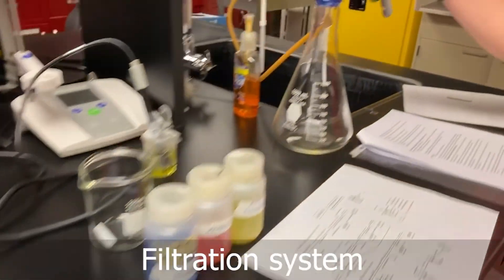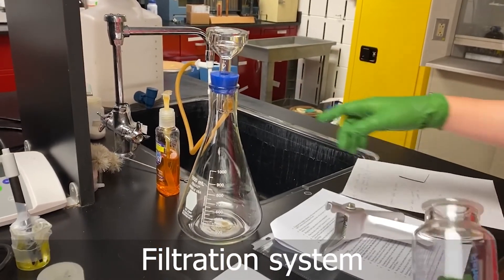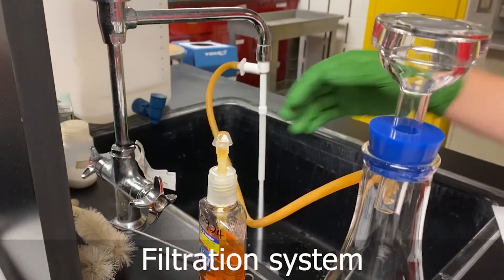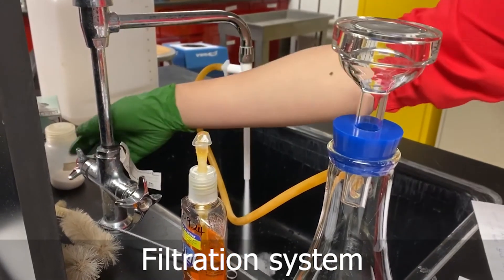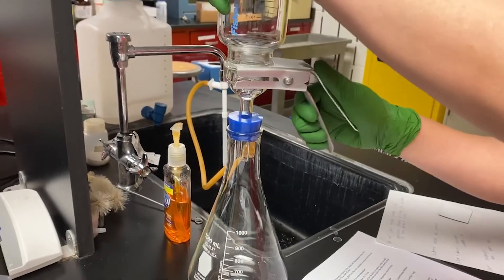And this is a filtration system. We can separate it like this, and when we do the vacuum, we can just open the water so it will create your vacuum.